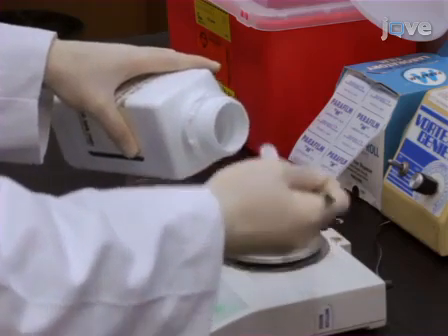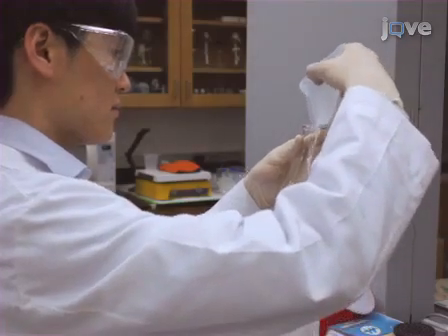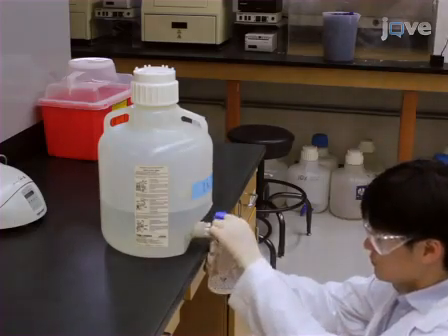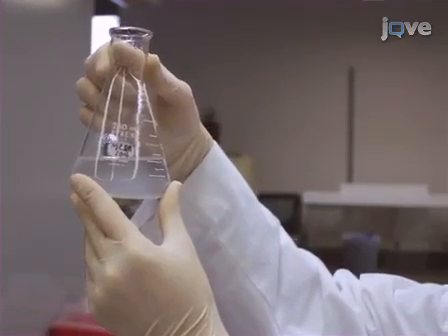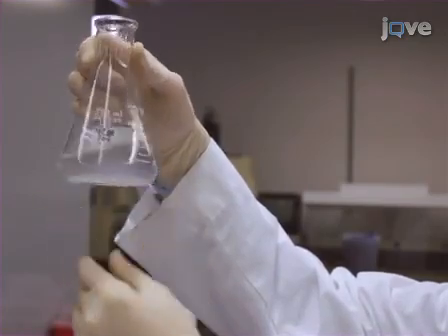To begin the procedure for making a gel, weigh out the appropriate mass of agarose into an Erlenmeyer flask. Add the appropriate volume of running buffer to the flask. The volume of the buffer should not be greater than one-third of the capacity of the flask. Swirl to mix.